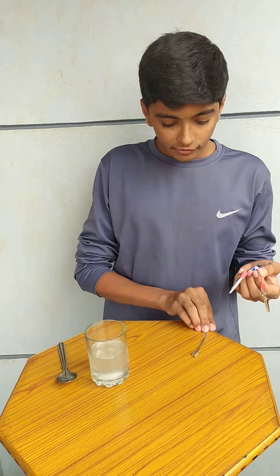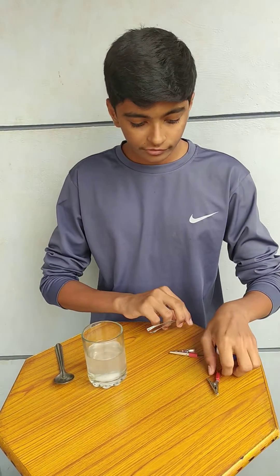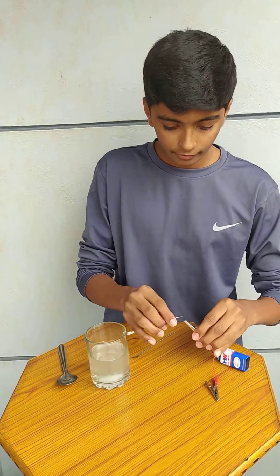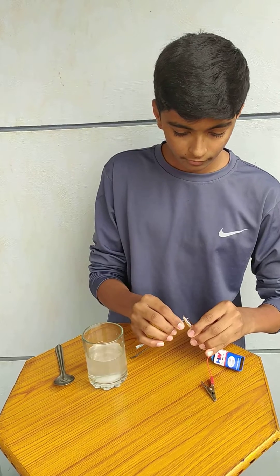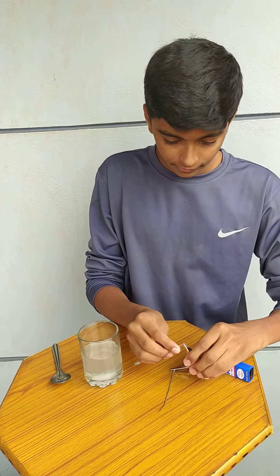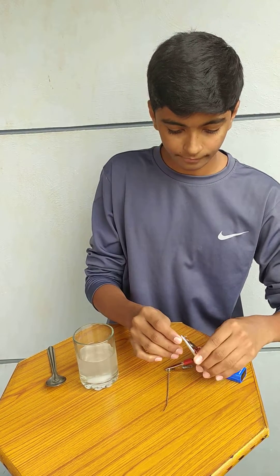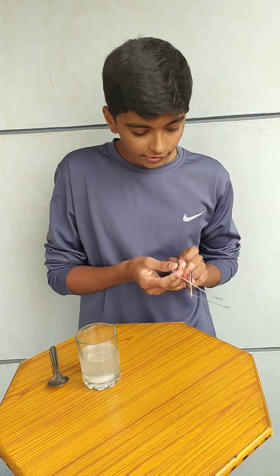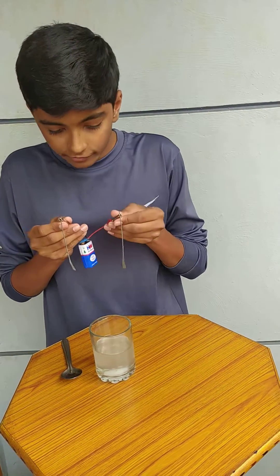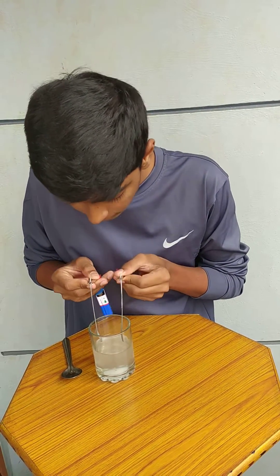We can use either of these as anode or cathode. Now I am using this as anode and the other as cathode. Now, for starting this, I am dipping these electrodes into the aqueous NaCl solution.